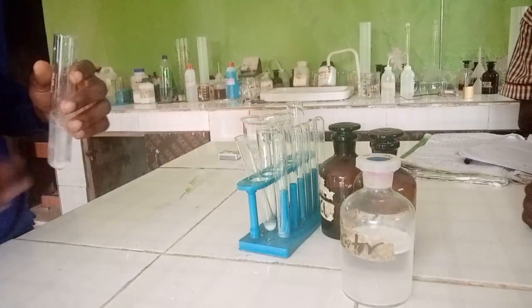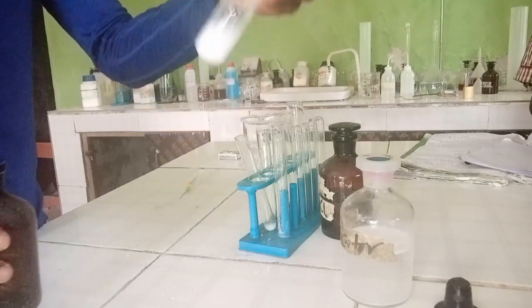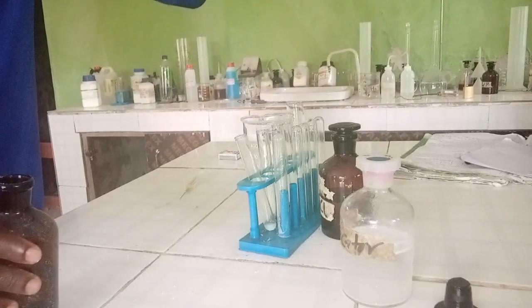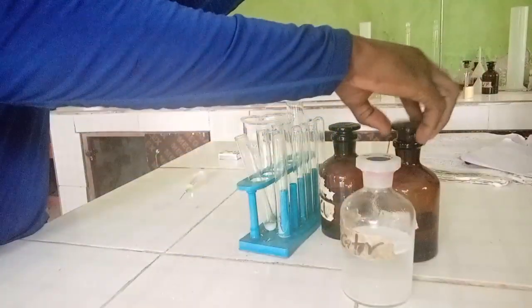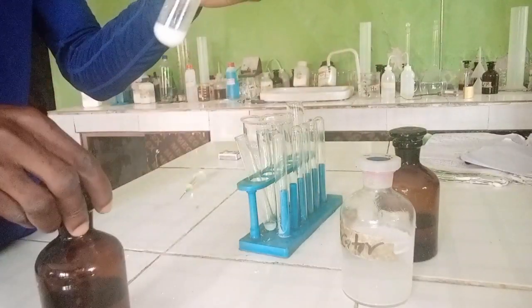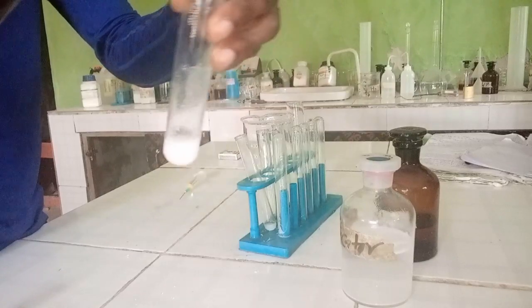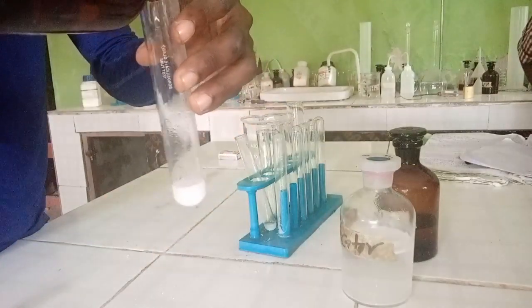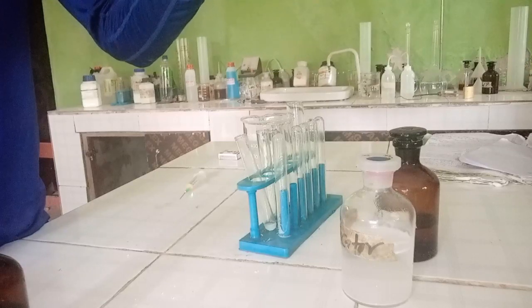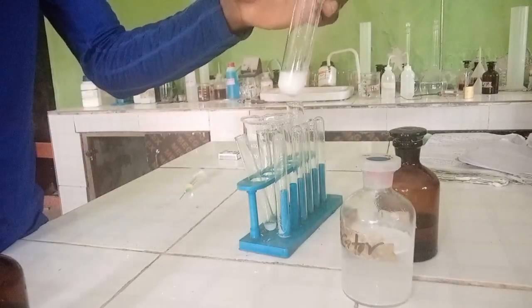To the first portion, we are told to add barium chloride. This is barium chloride solution — let's add it and see what happens. I can see white precipitates formed — not gelatinous, just white precipitates. Then the next step is to add HCl. On adding HCl, the precipitates dissolve — effervescence occurs and the precipitates dissolve in HCl completely.